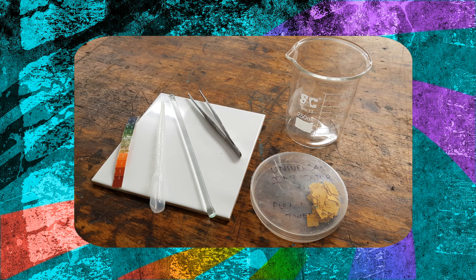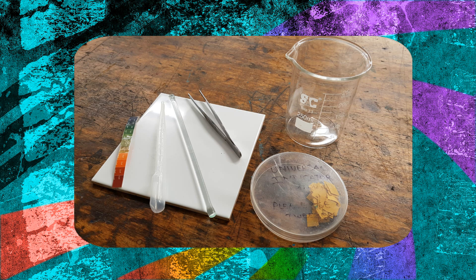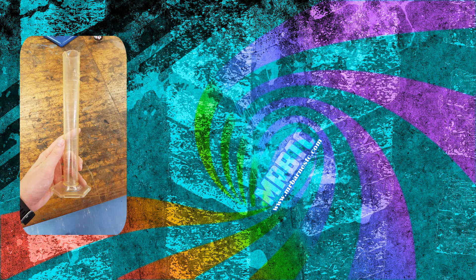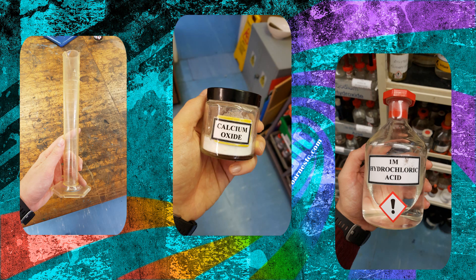To carry out this experiment you'll need a few things: a pipette, a glass rod for stirring, some tweezers, a white tile, a beaker and some universal indicator paper. You'll also need a measuring cylinder, some hydrochloric acid, and some calcium oxide or hydroxide.